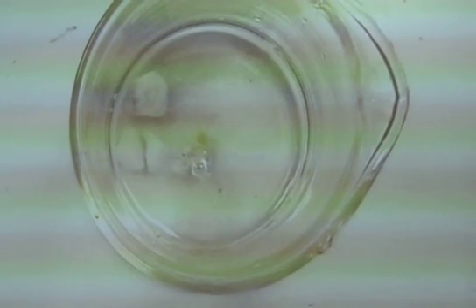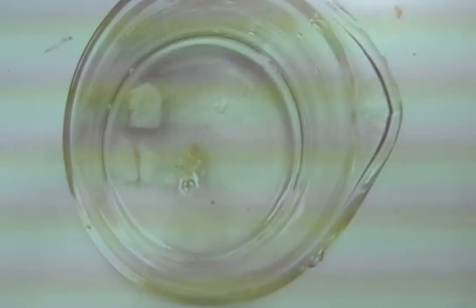Okay, you know how it's getting bigger and bigger? Is it on the surface, or does it get bigger and bigger? That's on the surface where it gets bigger until it pops. It doesn't get bigger while coming up? Yeah, a little bit bigger coming up, because there's less pressure on the surface.